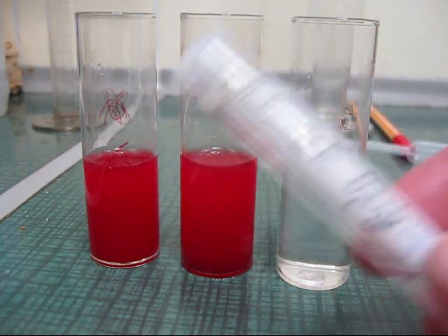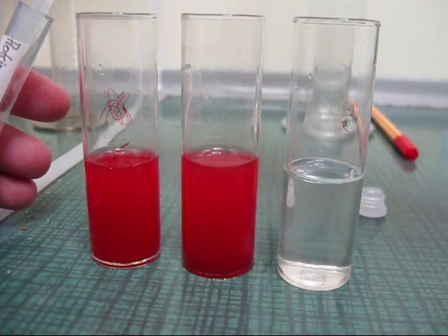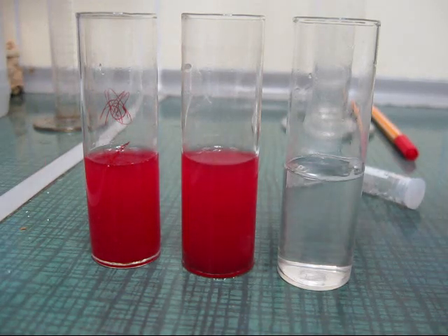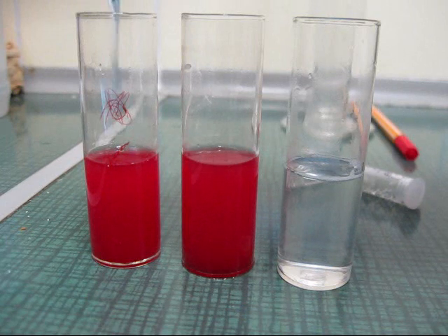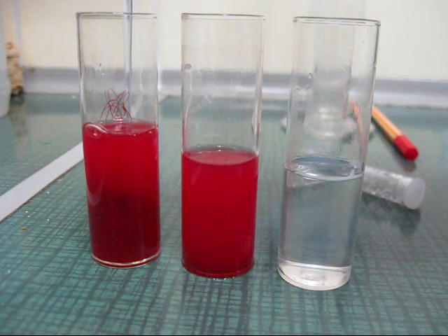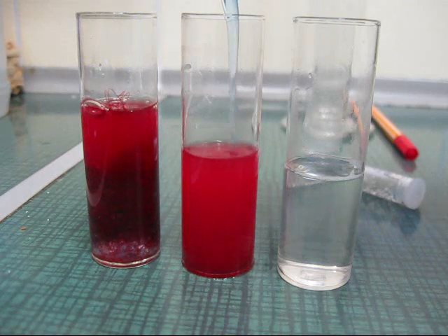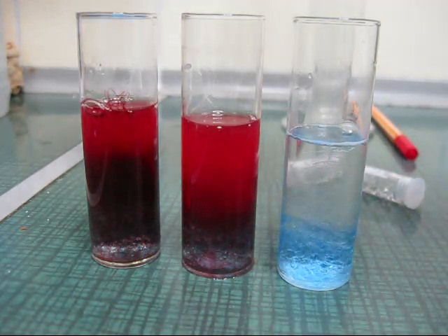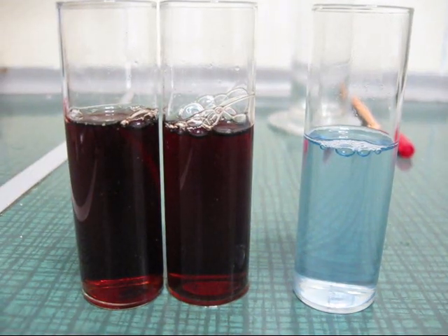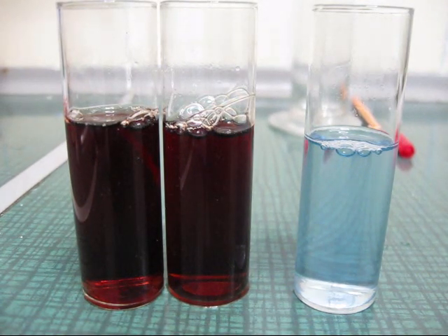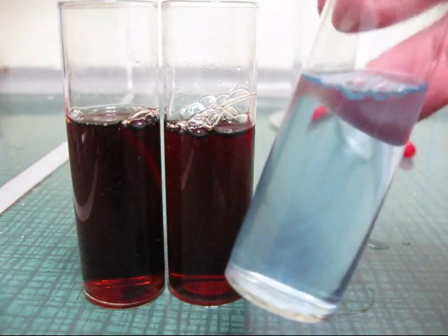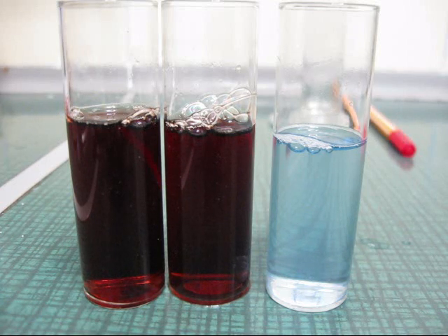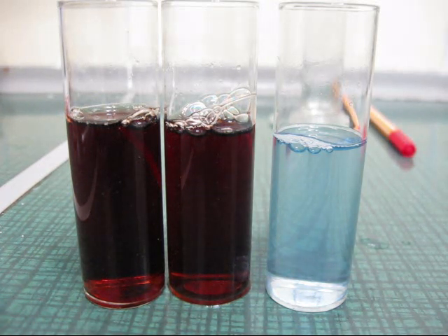Okay, now I am going to add the proteinase and add the dishwashing fluid. Actually I should have added the dishwashing fluid earlier, like in the beginning of the experiment, but that's what you get for trying to do stuff. Well, actually I am having no time. Oh well, never mind. We will see how it works out.